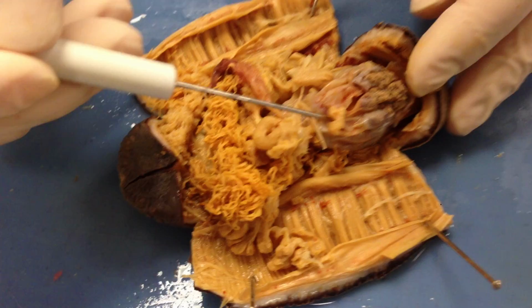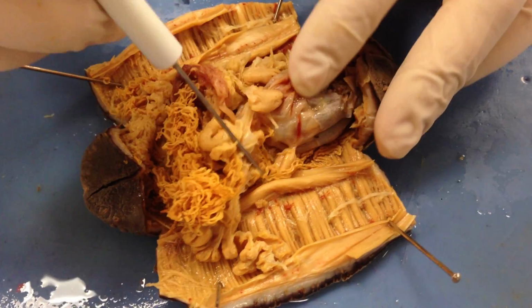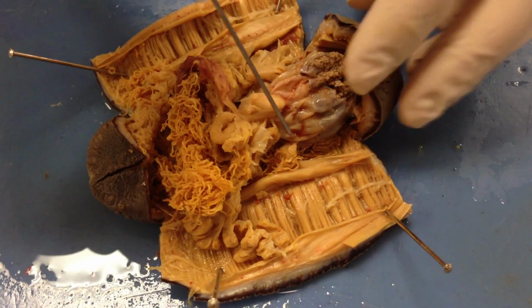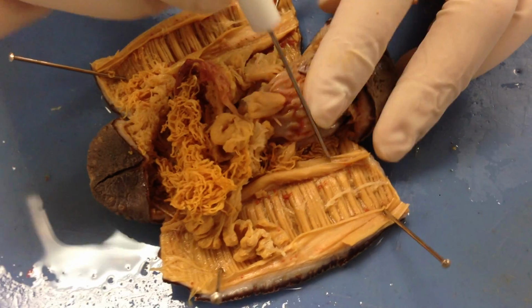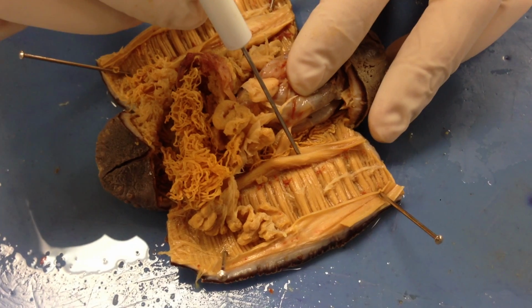You can see here these muscles are called retractor muscles, and they're used to help keep the bulb together, and it helps to expel the tentacles later on when they're going to feed. These muscles that run down the body that the retractor muscles run into are the longitudinal muscles.